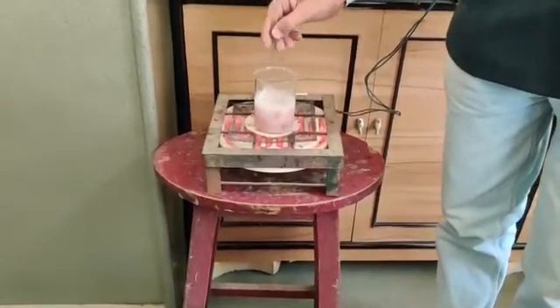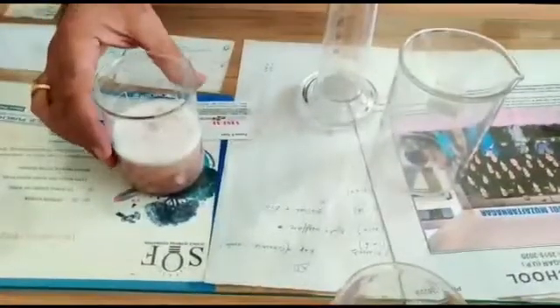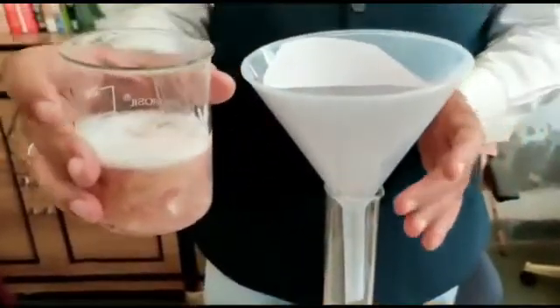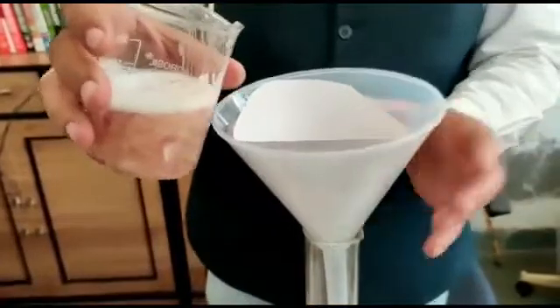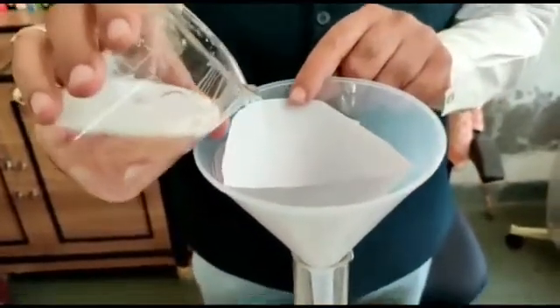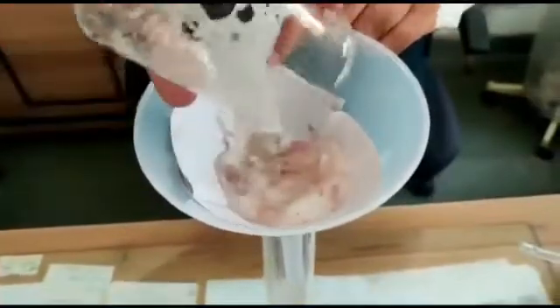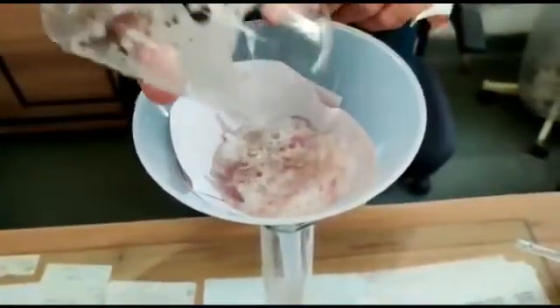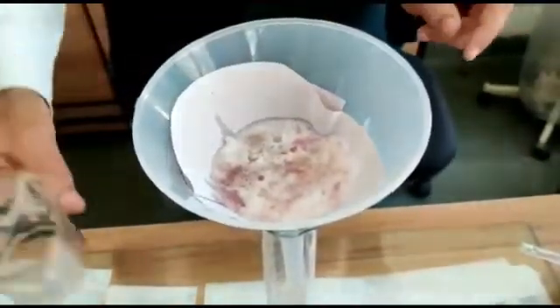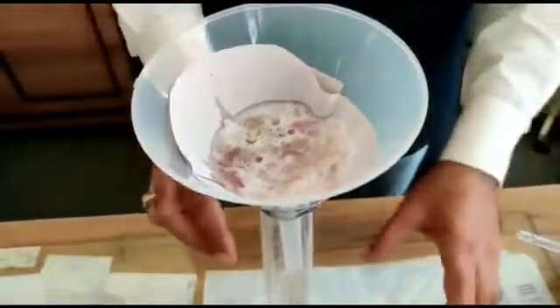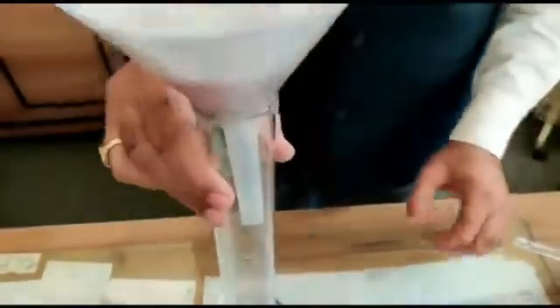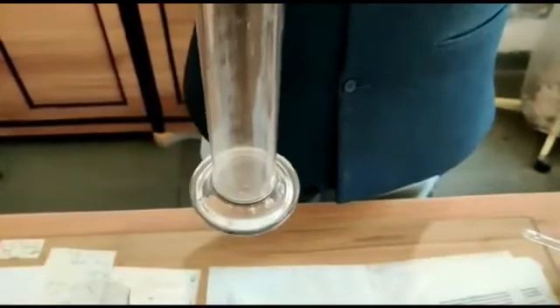Now this mixture has cooled down. When you ensure it is quite cool, then you filter it. We have to collect the filtrate.